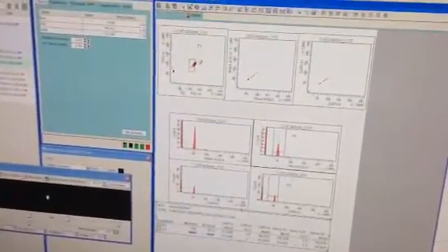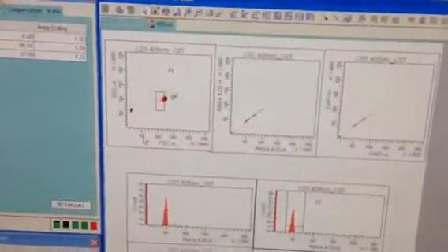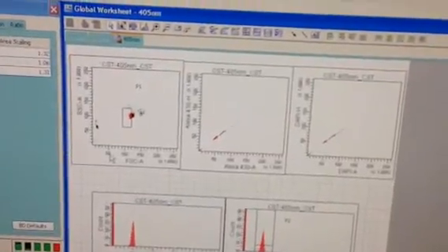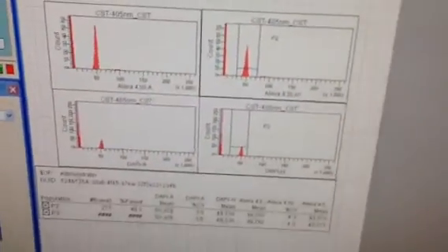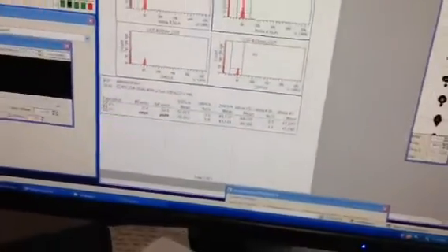And so now that we're there, we can see that compared to earlier, the DAPI channel is now a little tighter, so the CVs would be a little better on that signal. Before we had a CV of 8 or something on DAPI, and now we have a CV of 4.